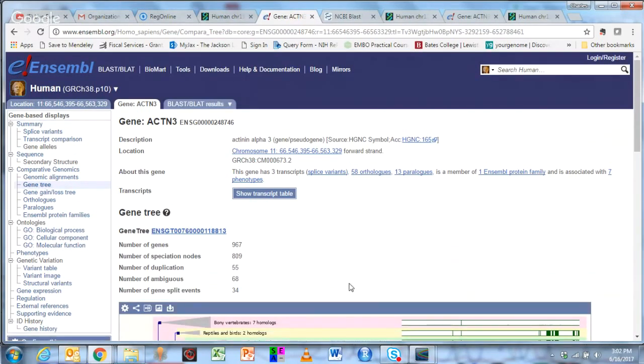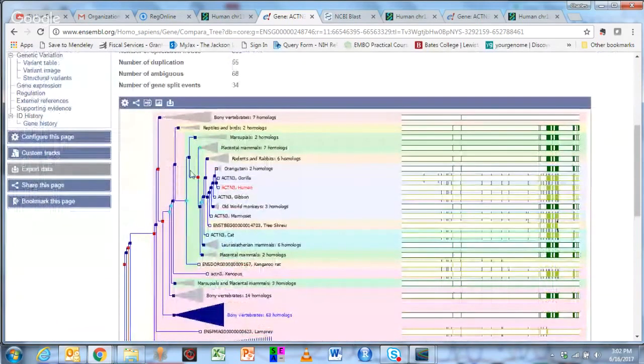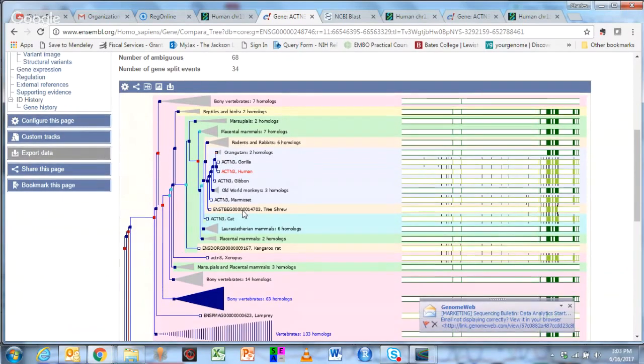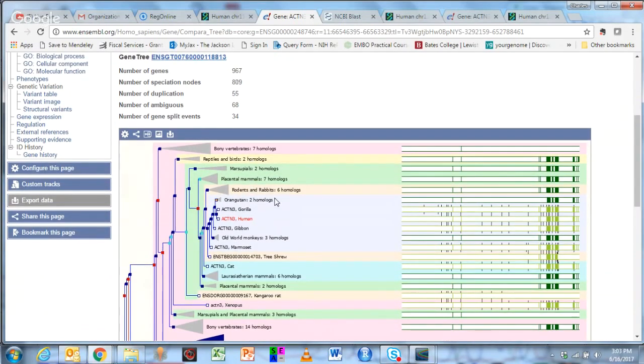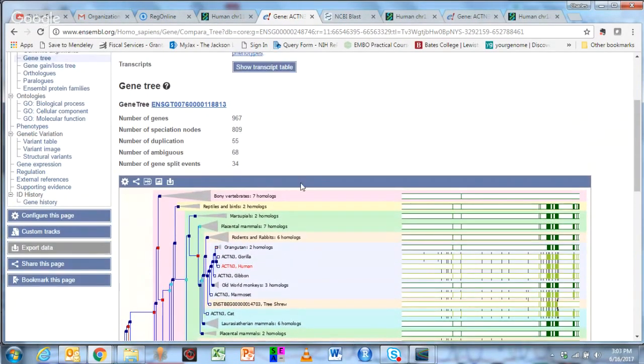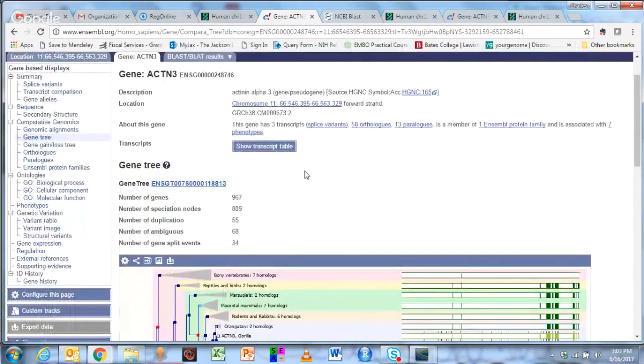The gene tree builds a phylogenetic tree or evolutionary reconstruction. And right here in the middle, you see the human actinin 3, that's our sequence, and you can see its nearest neighbor is gorilla. Here's chimpanzee. I'm not sure why gibbon and gorilla. I'm not sure why chimpanzee isn't showing up. And also, you can expand these to look at mouse, for example. So the next step is understanding, does this sequence or this gene lend a function?